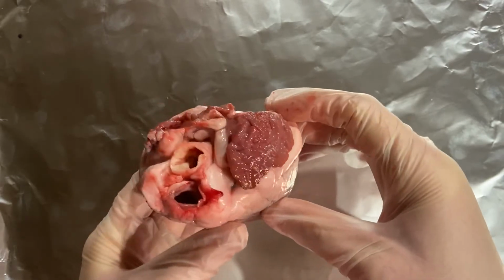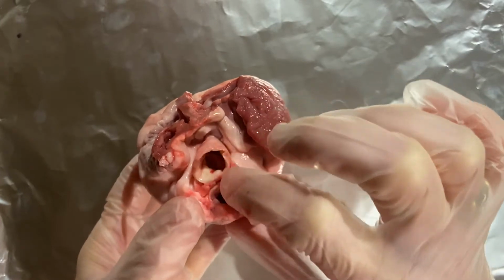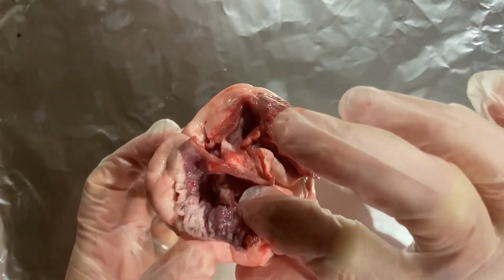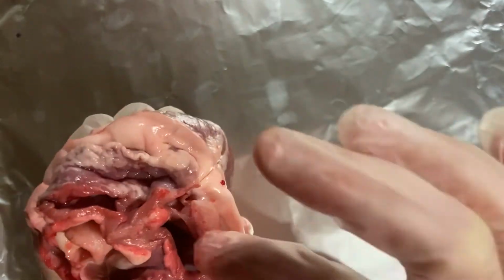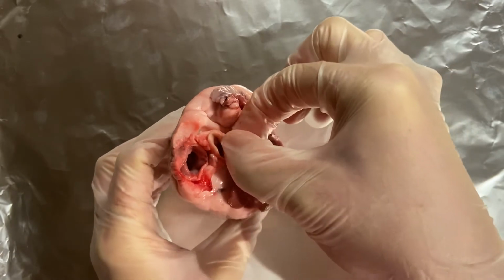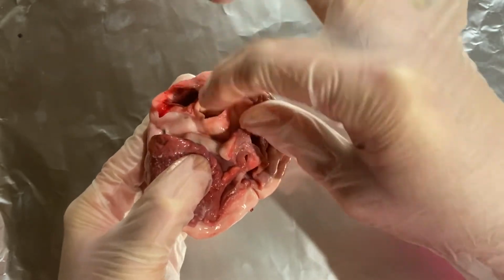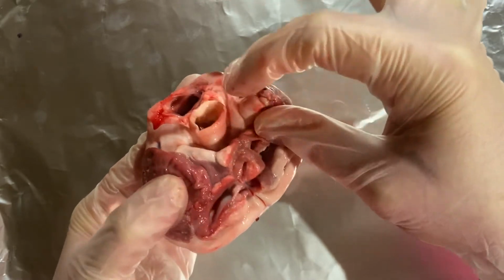Now, what I want to show you over here before I start dissecting this is the beautiful big blood vessels going to and away from the heart. And we've established that the biggest blood vessel is this one over here, and you can just see how wide that blood vessel is. This one over here, the way it's been cut by the lovely butcher in Marden who donated this, you can see the amazing muscular and elastic tissue that makes up these blood vessels.